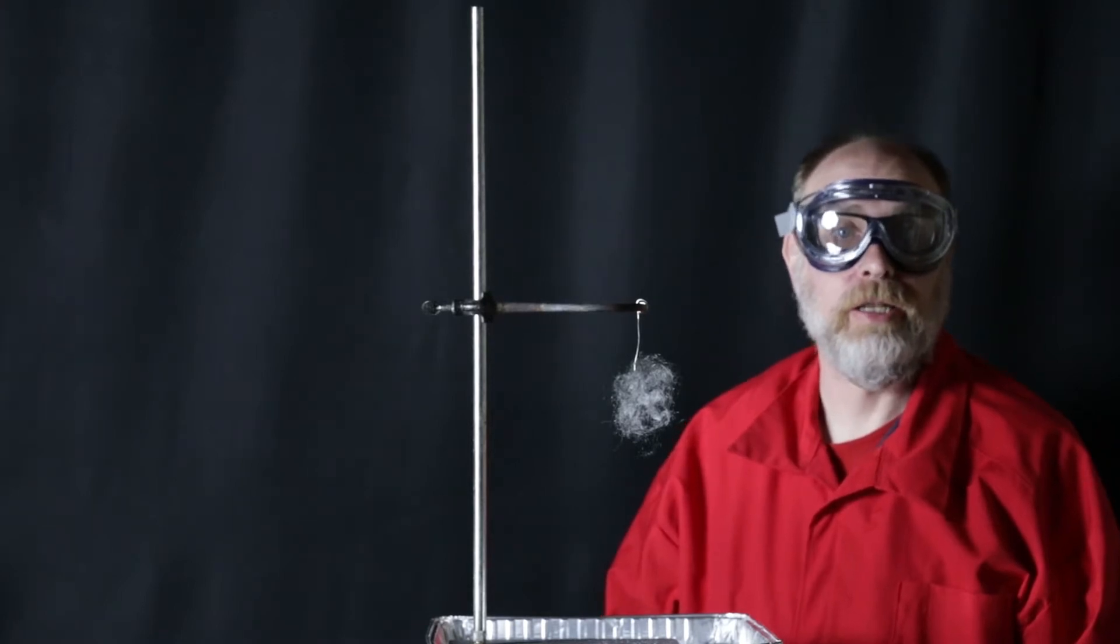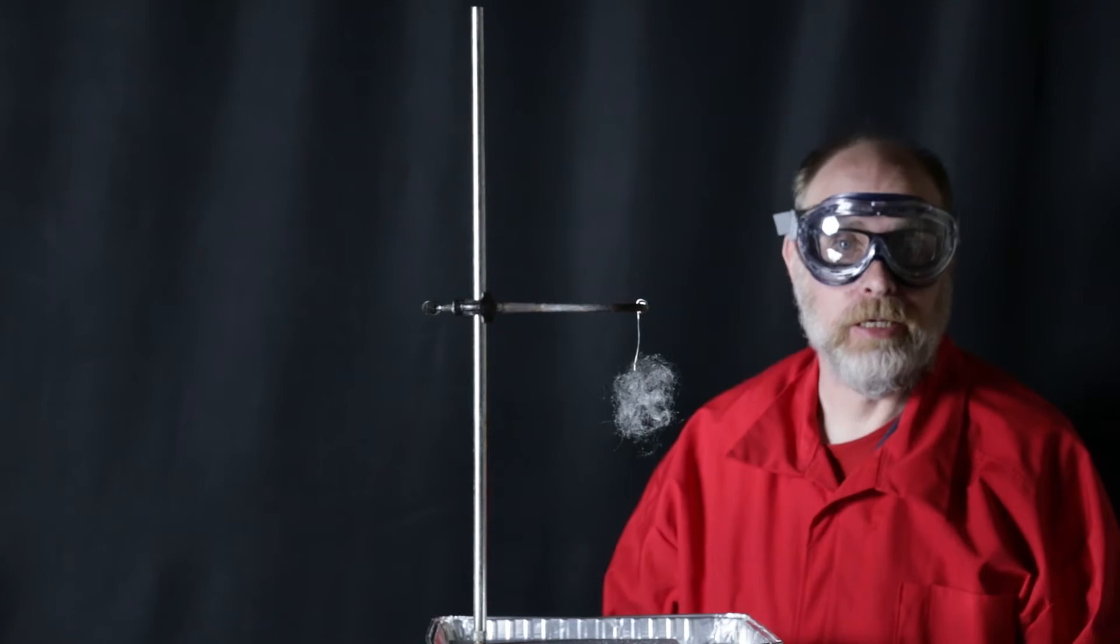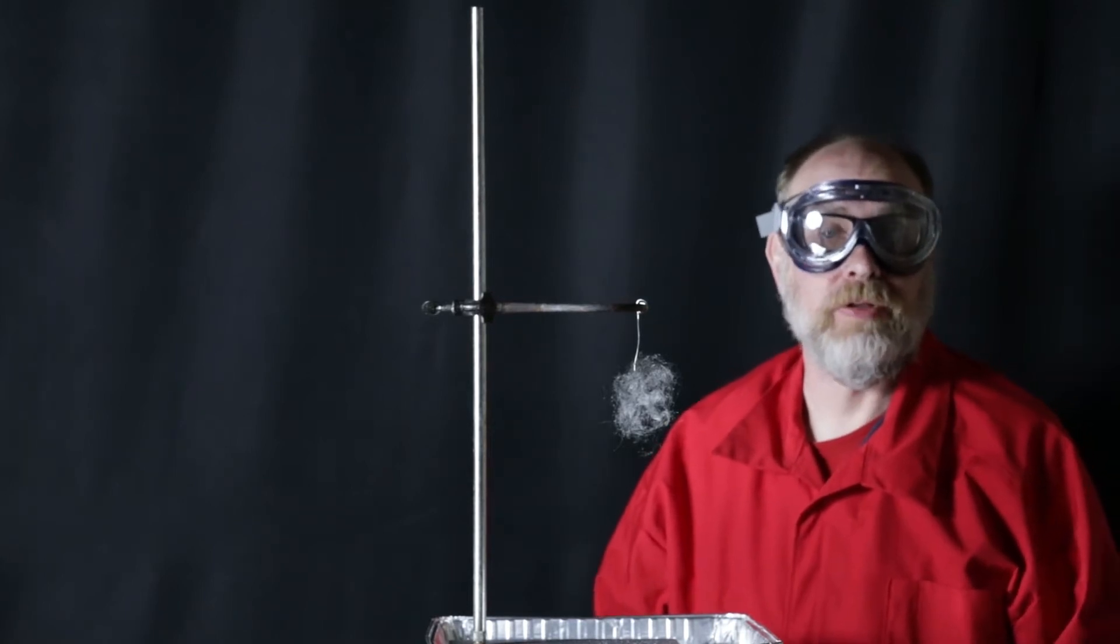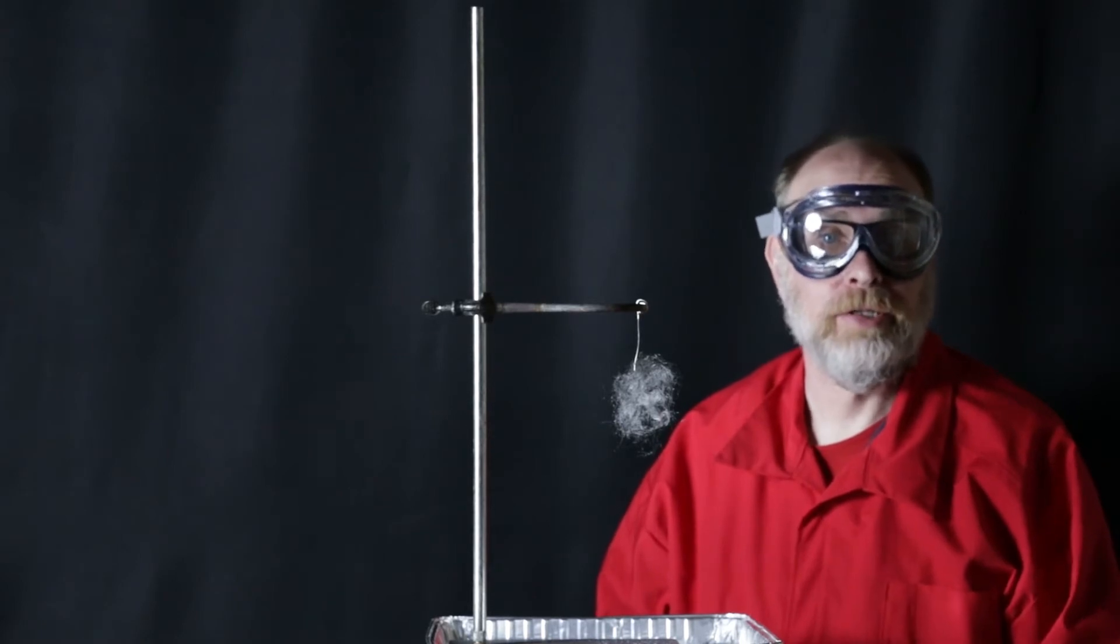All right, so I want to show you a really interesting demonstration today, a chemical reaction. You all know what happens if you leave your car sitting out in the rain for long periods of time. The metal will start to rust. The iron will start to oxidize. Well, we're going to do that same chemical reaction except we're going to do it really, really fast.